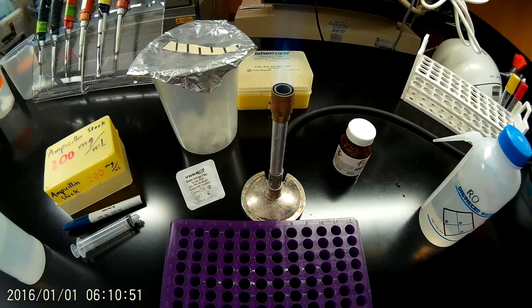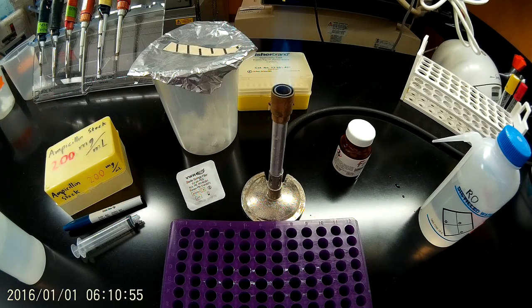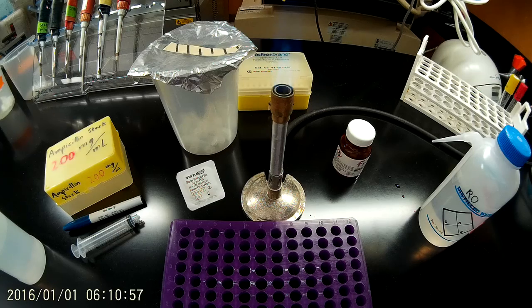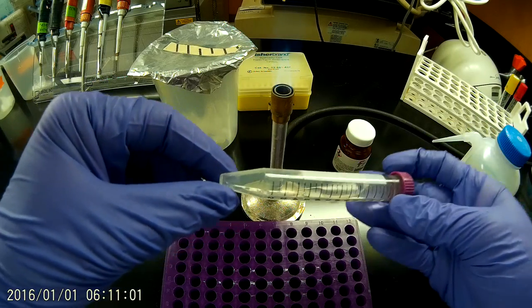I'm going to keep shaking that, and eventually we will have a solution that is completely dissolved, like so.